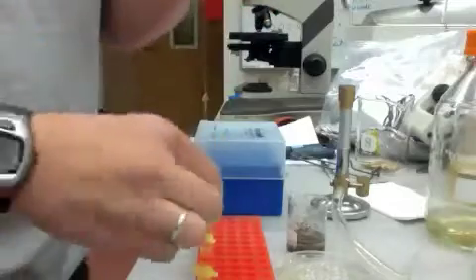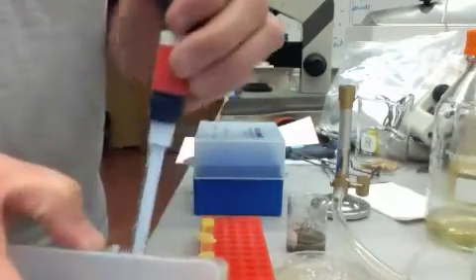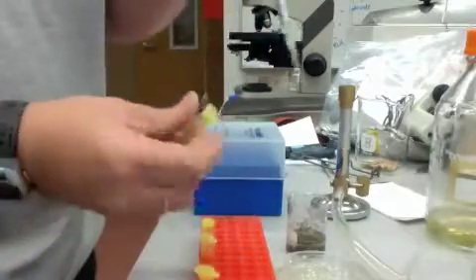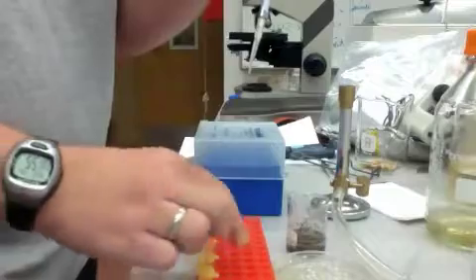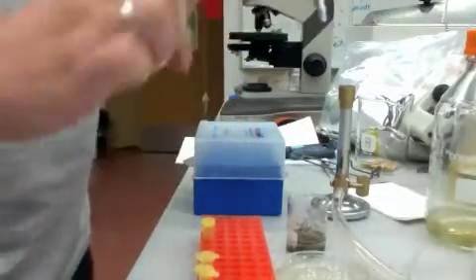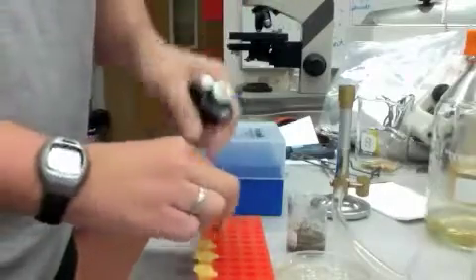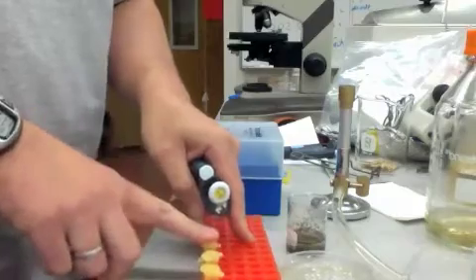Shake it up. Get a new tip. Go to the next one. And so on. So now I have a 1 to 10, a 1 to 100, and a 1 to 1,000 dilution.